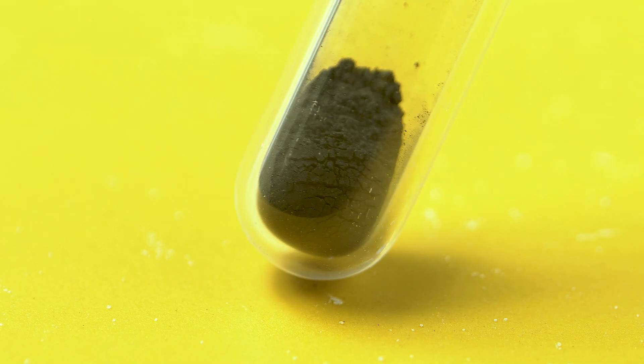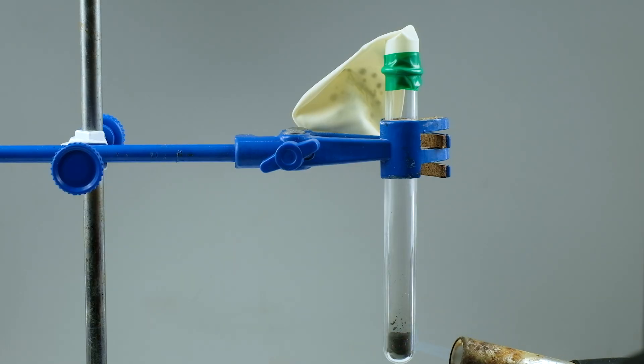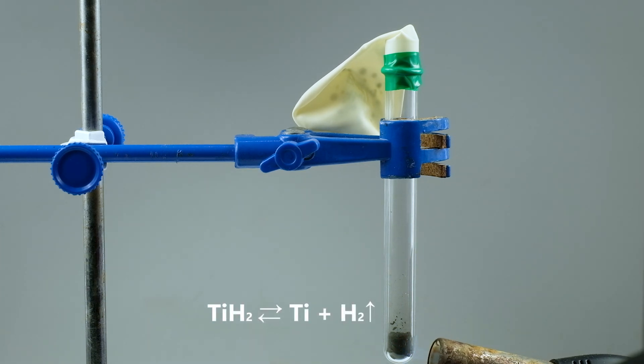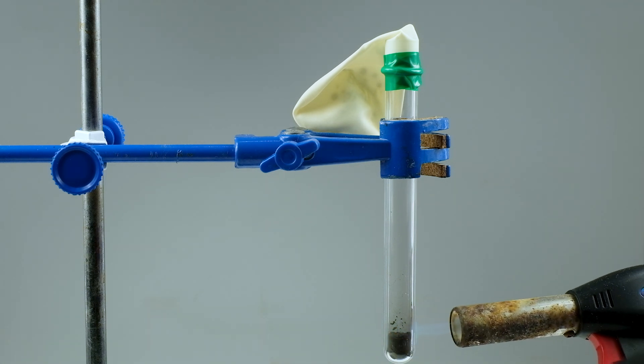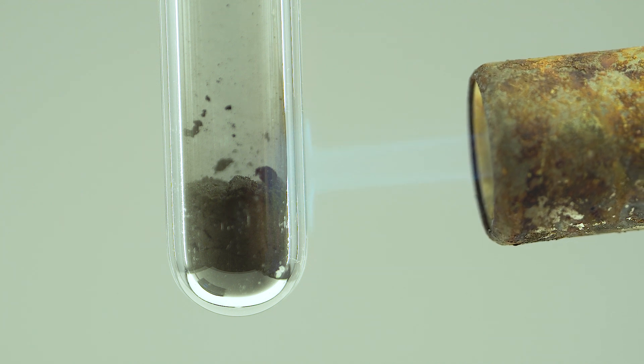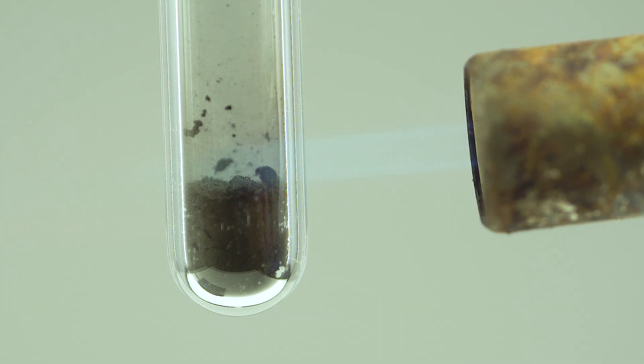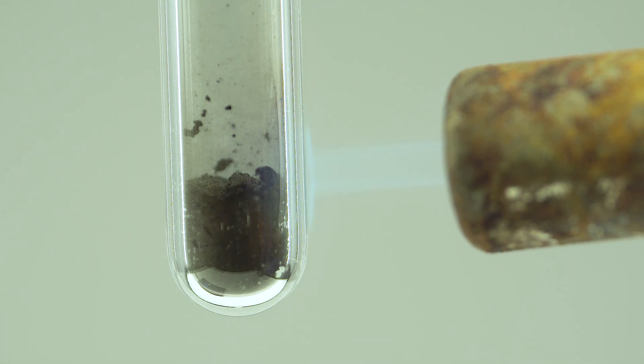But the main thing that I want to show you today is titanium hydride's reversible decomposition into titanium and hydrogen. To perform this, it must be heated to above 500 degrees Celsius. To dissociate titanium hydride, it is necessary to maintain a high temperature. See how interesting the evolution of hydrogen is.